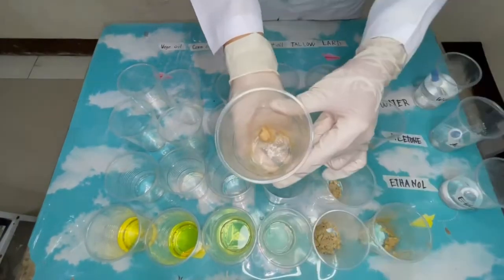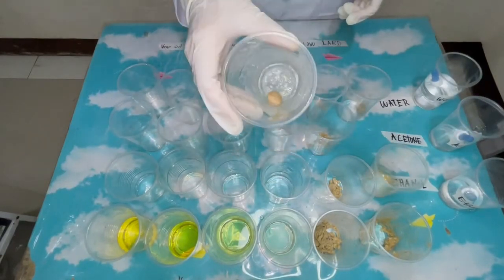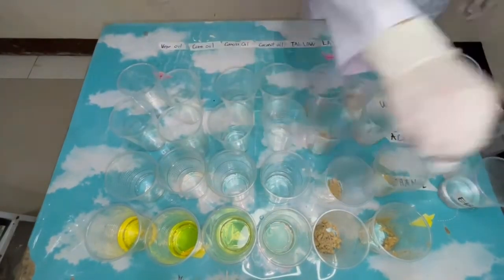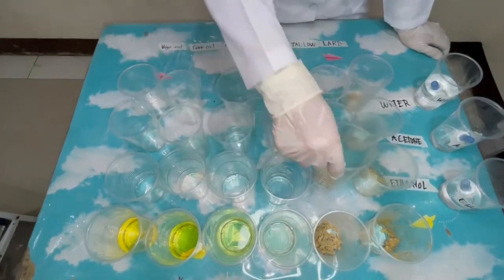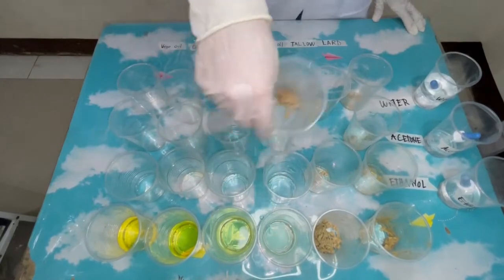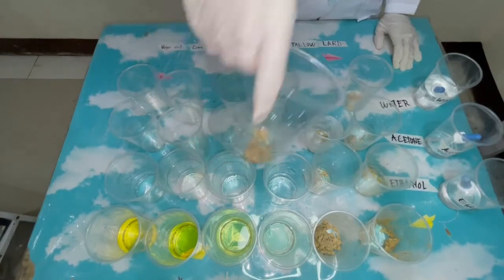The lard in ethanol solvent is slightly soluble. In acetone, it is also slightly soluble. And in water solvent, it is insoluble. For tallow's solubility in ethanol, it is insoluble. Tallow's solubility in acetone is also insoluble. And tallow's solubility in water is definitely insoluble.